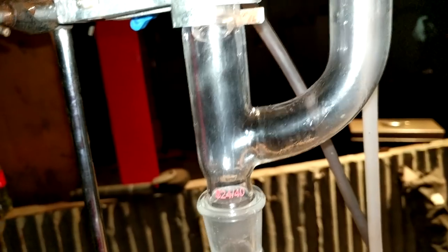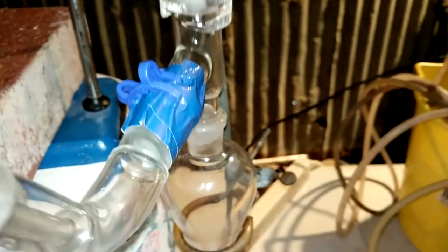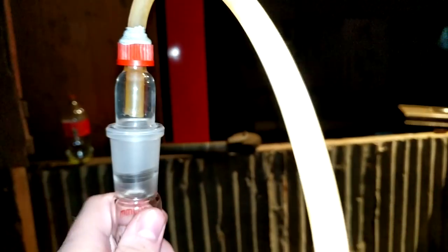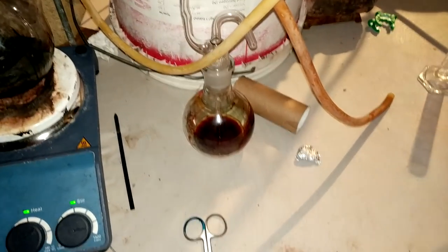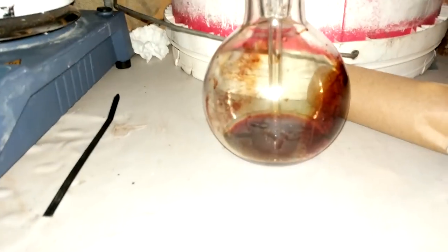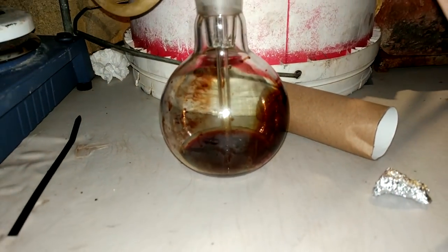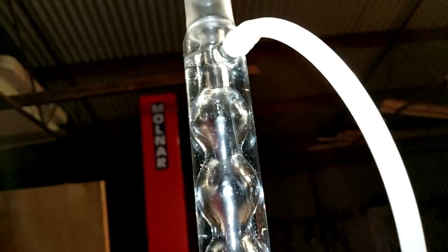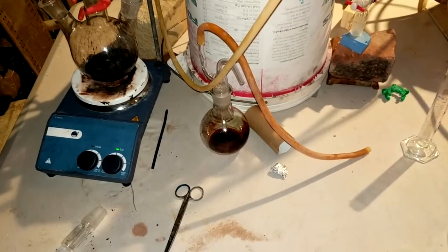Well, I think I might have totally fixed it. All of a sudden, we've got all this liquid forming here and everything, and it's working perfectly. Oh, look, and it's dripping down. Short of me actually putting tertiary butanol in just directly into the flask, what I've done is I decided that maybe the isobutene is getting absorbed or reacting with the sulfuric acid in that flask, which is why I was making that weird color. So, I just diverted it, and all of a sudden, when I put this into the flask, all of a sudden it just took off. So I've just had three and a half hours of nothing, just because it looks like all my gas has been pumping into there.